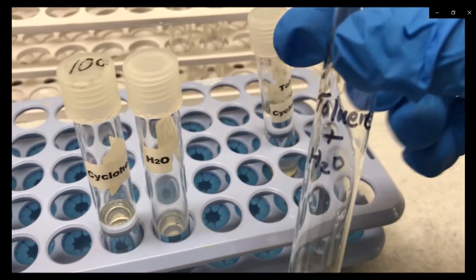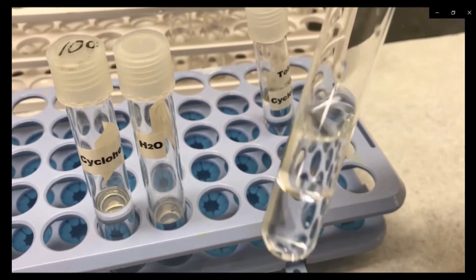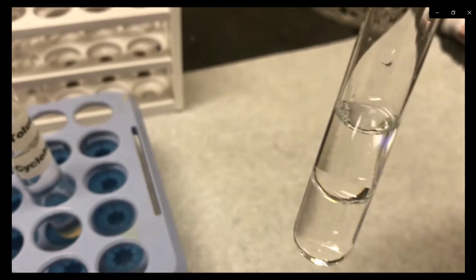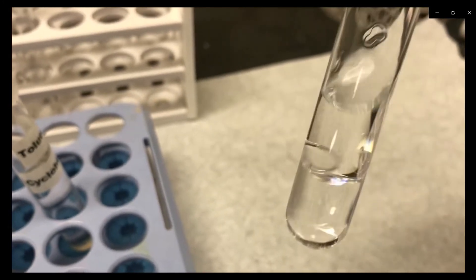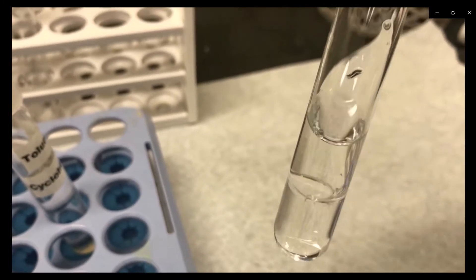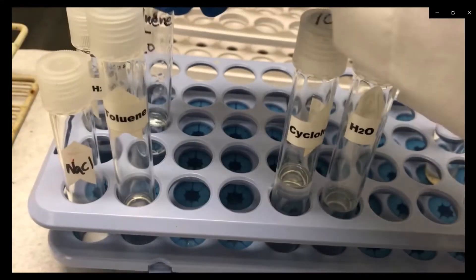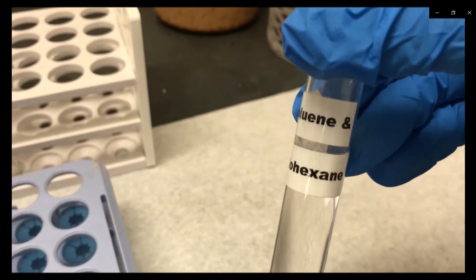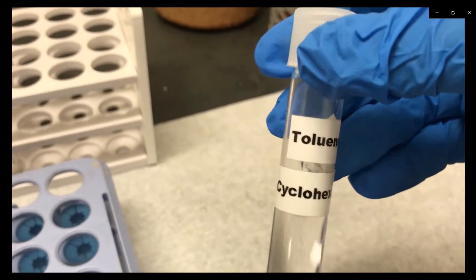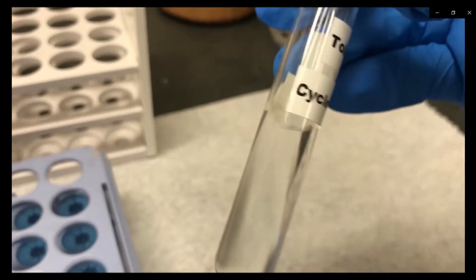Toluene is not soluble in water — you can see the two layers, showing it is insoluble. Whereas toluene is completely soluble in cyclohexane.